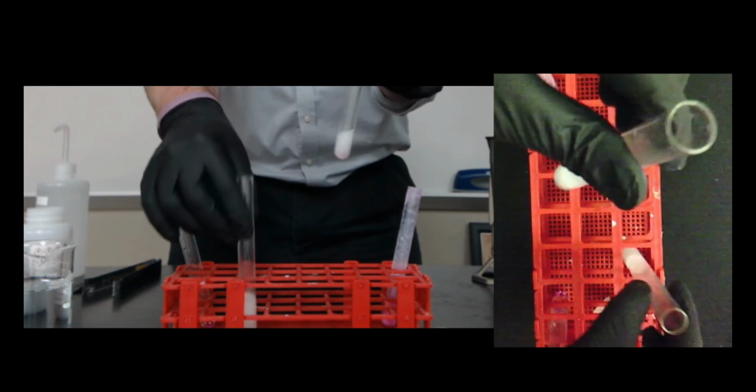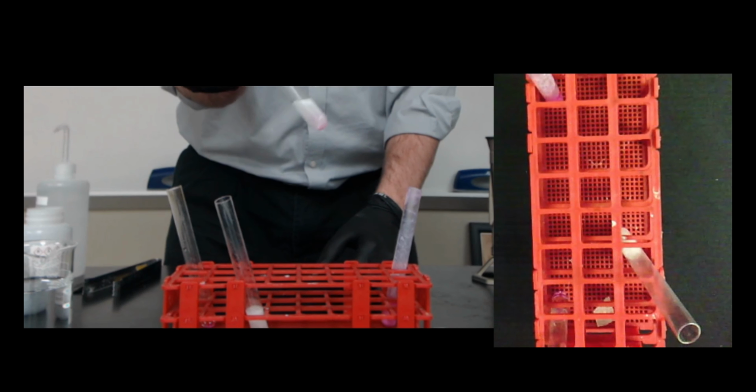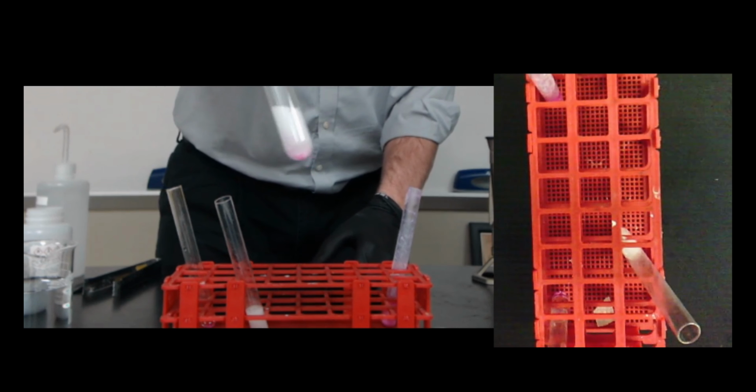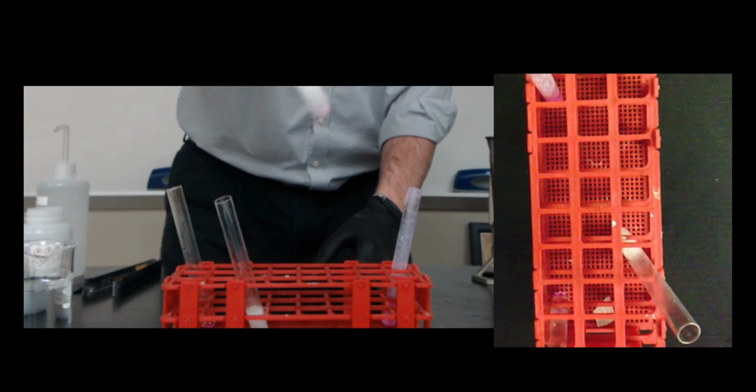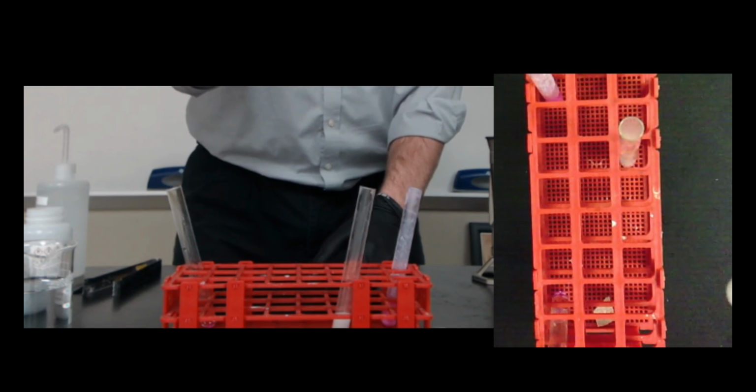Now they're still reacting, if you can hear them, and you can see they're still producing bubbles. I'm going to try to mix these up a little bit. And you can see at the bottom, hopefully, this is the calcium. It's starting to turn pink. Slowly, but it's starting to turn pink. If you look at the magnesium, there is no pink at all in here.